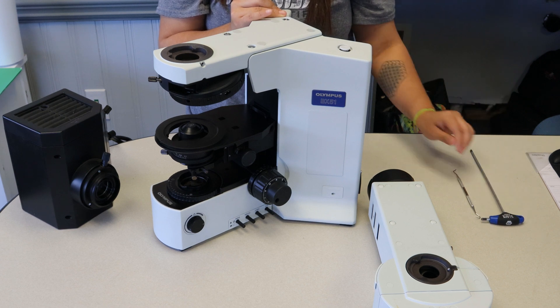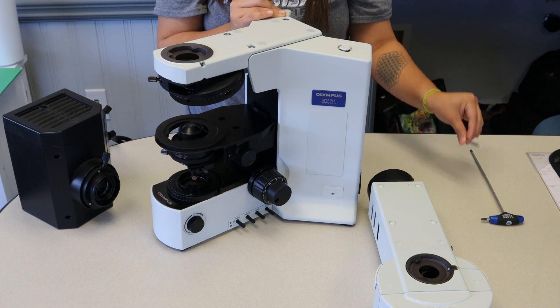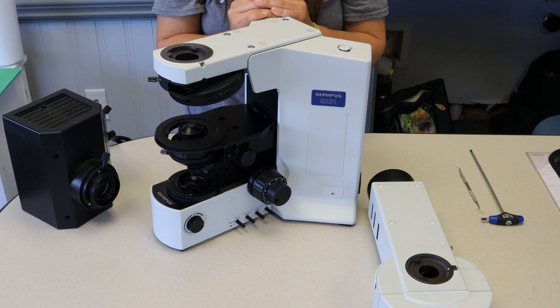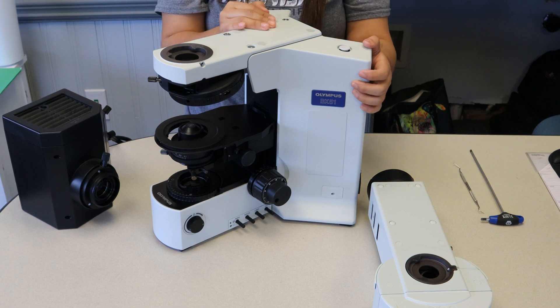And a small pick tool. It doesn't really have to be a dental pick like we're using, but just a small pointy object to help remove some adhesive caps. Of course, you're also going to need your fluorescent lamp house and the fluorescent attachment itself.